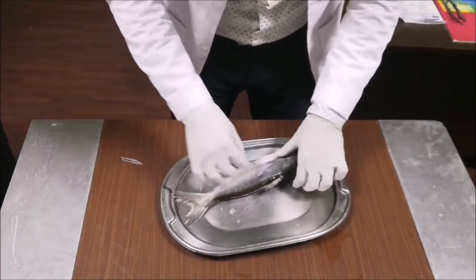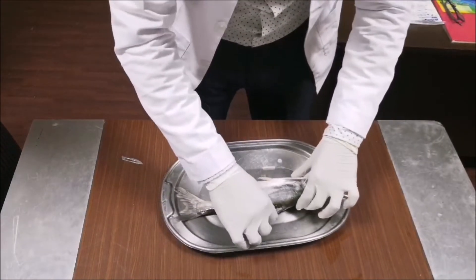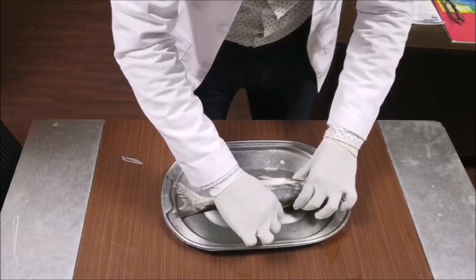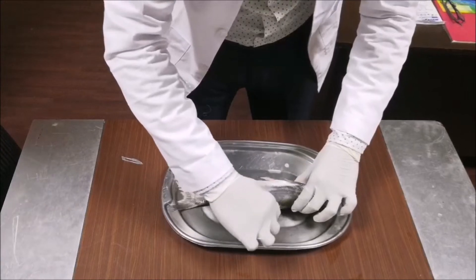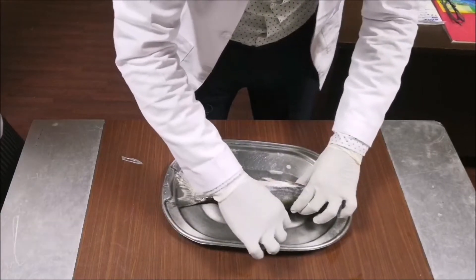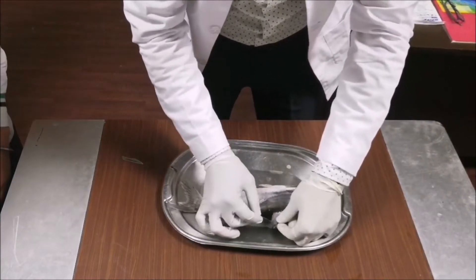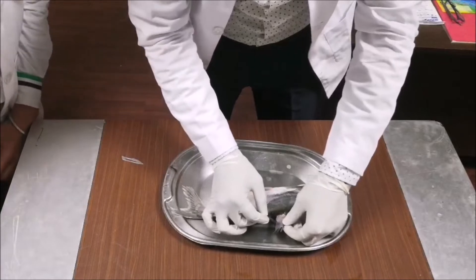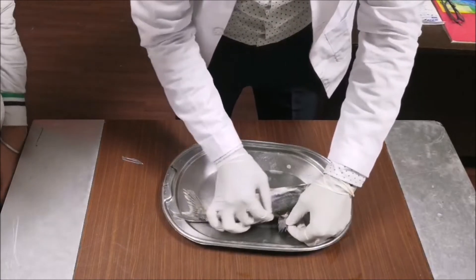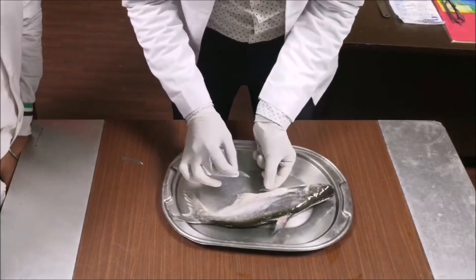With the help of these fins, they swim. These fins are having some bones — you can see these bones, you can experience them. They are these bony structures.